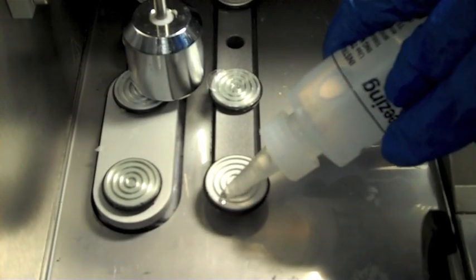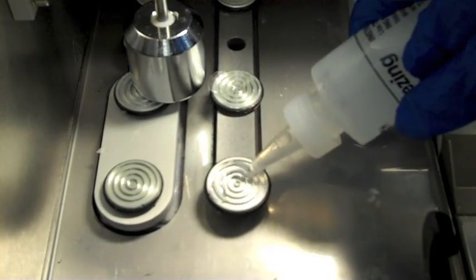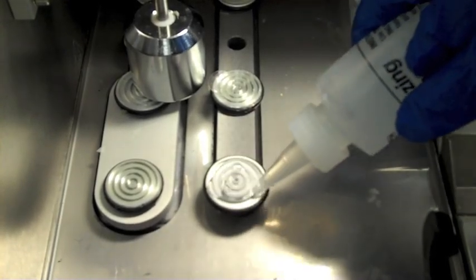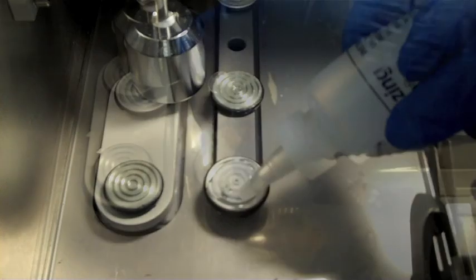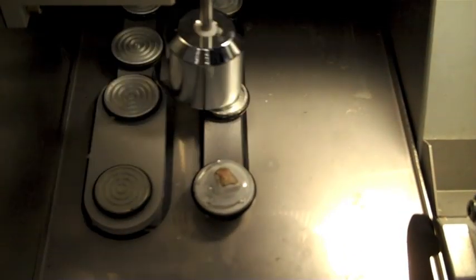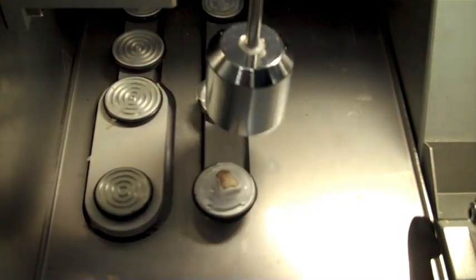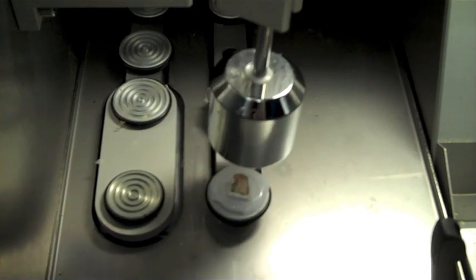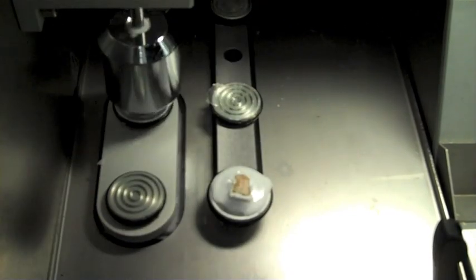Place a layer of freezing media onto a specimen chuck. Mount the sample in the media. Place the heat extractor on top of the sample. In approximately 30 seconds, your specimen will be entirely frozen.